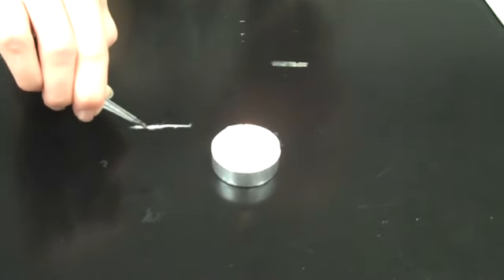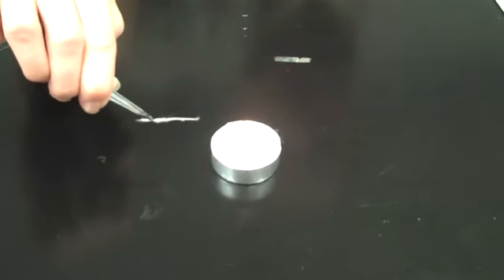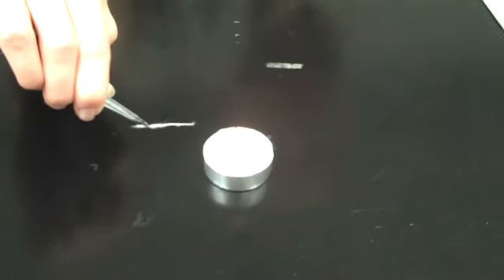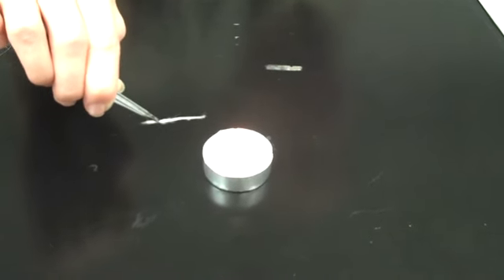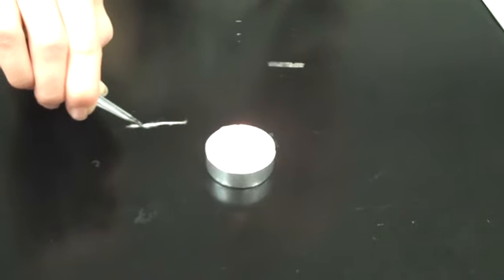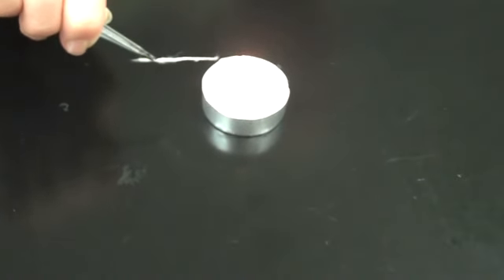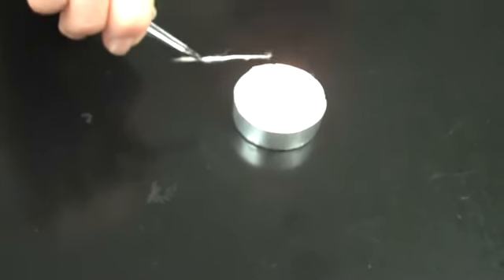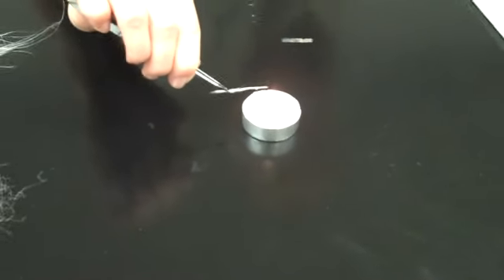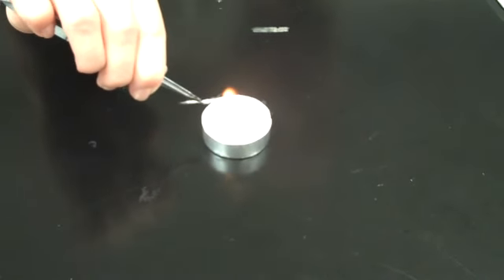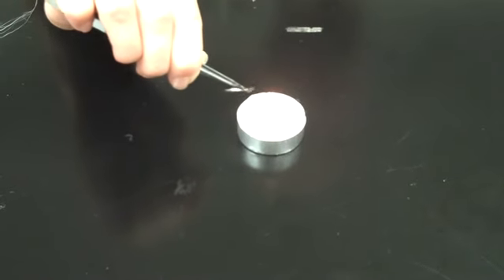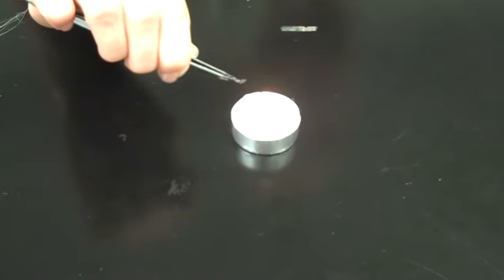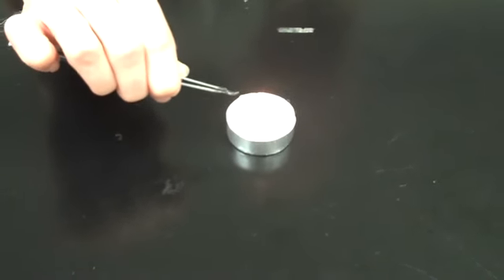The next thing you want to do is go ahead and burn your fibers. What you're looking for are the characteristics of the fiber when it burns. You want to look at the flame, see how fast it burns, how large it burns, the color of it burning. It'll burn up to the point where I'm holding it with the tweezers since I've bundled my fibers nice and tightly.